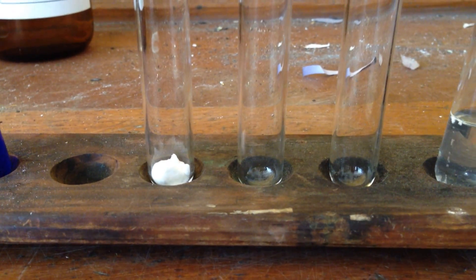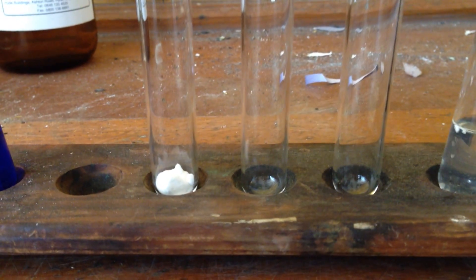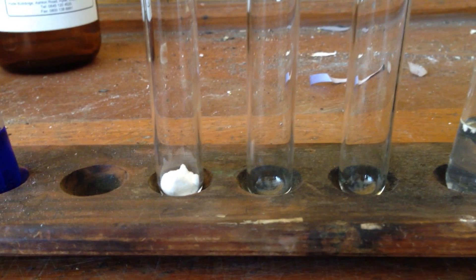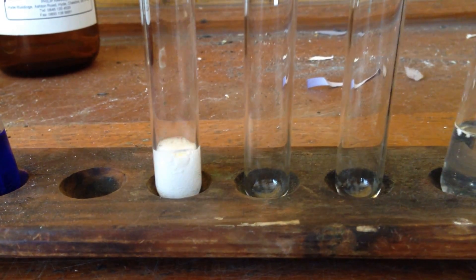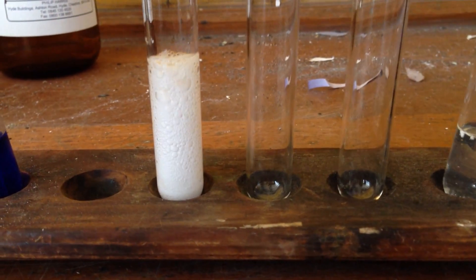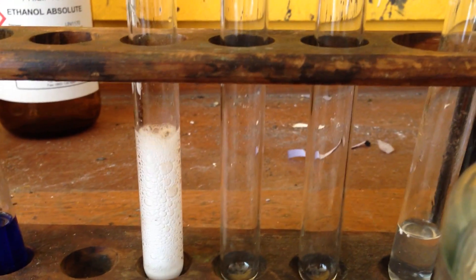So here we are just testing for ethanoic acid. I have some solid sodium hydrogen carbonate in the bottom of this test tube here. I'm just going to add in the ethanoic acid and there we can see it fizzing away like crazy.